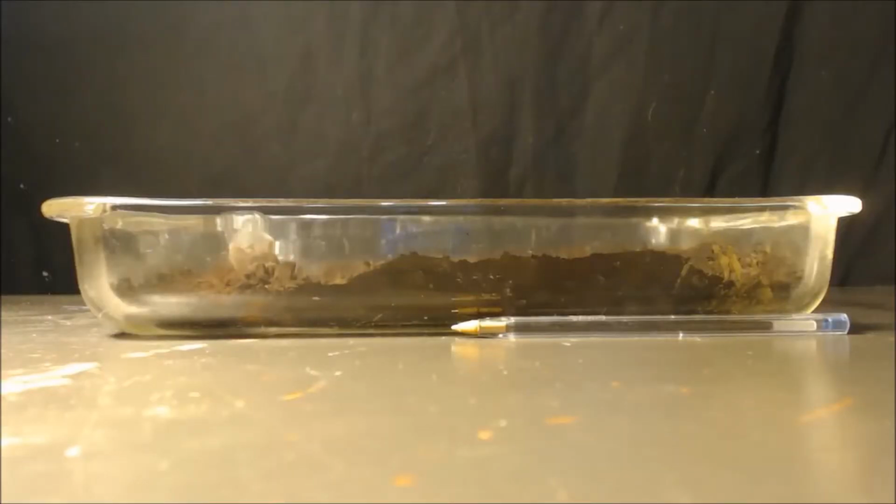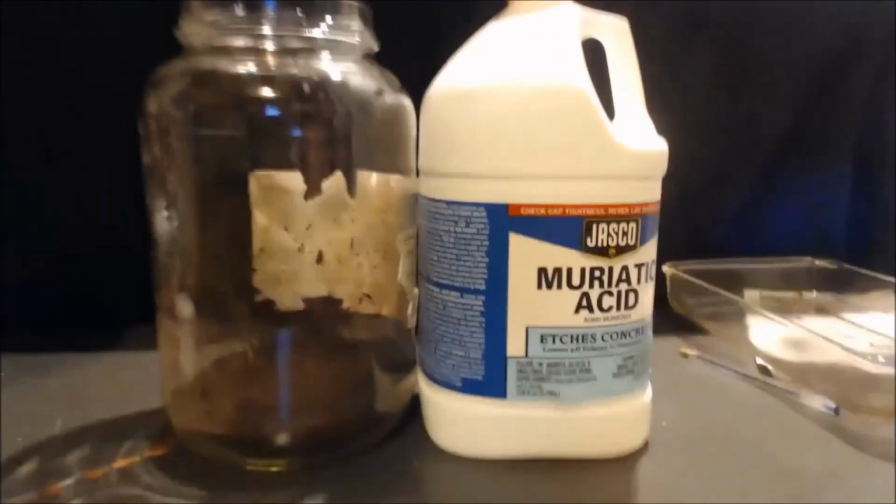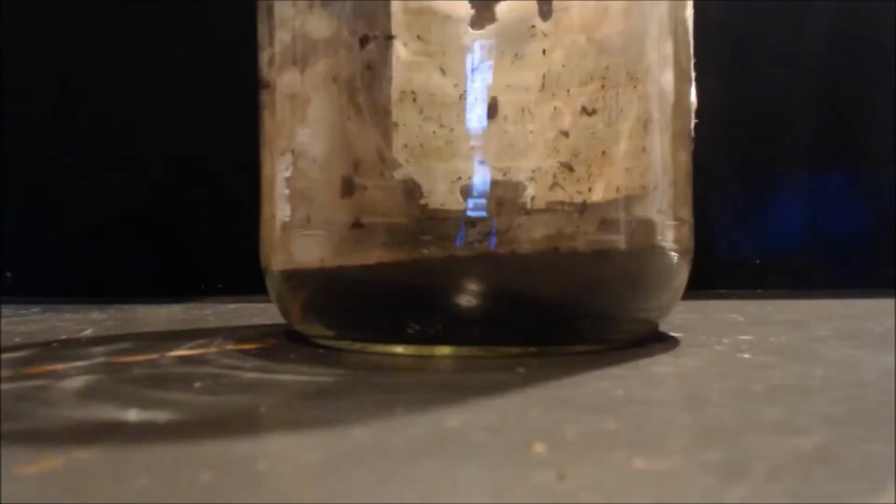I'm going to take that and put it in a big jar, and here it is in a big jar. I found this jar. I don't even know where this came from, but it's like a gallon. Here's a gallon next to it, to give you a little comparison. Now you can tell it's an old jar. It looks like an industrial jar, like a restaurant jar or something. But it's a gallon glass jar. You know what I mean? Those are hard to come by.